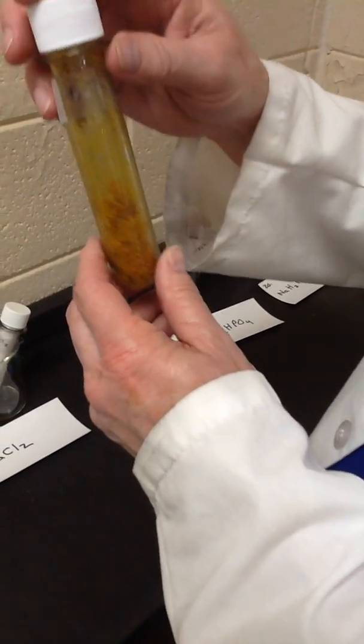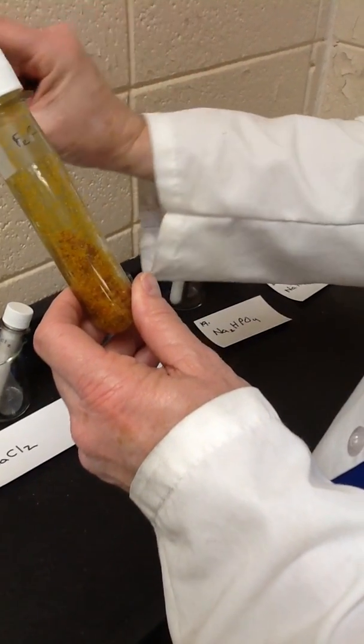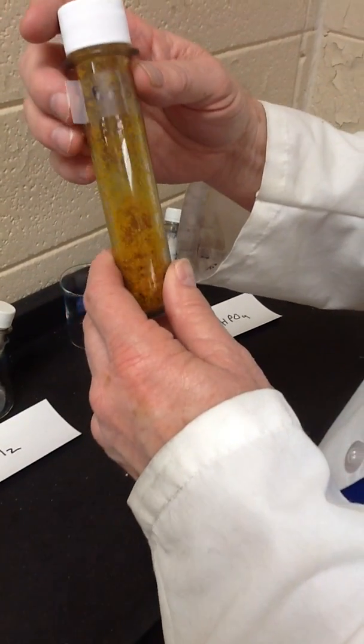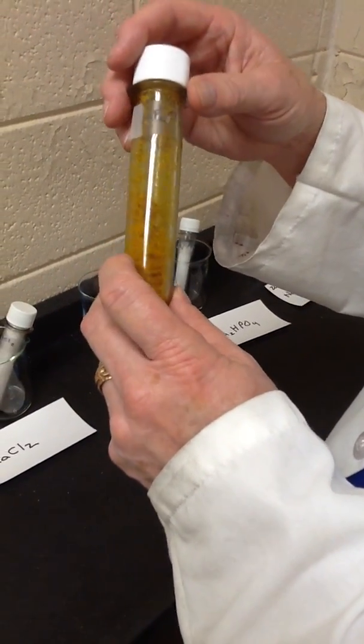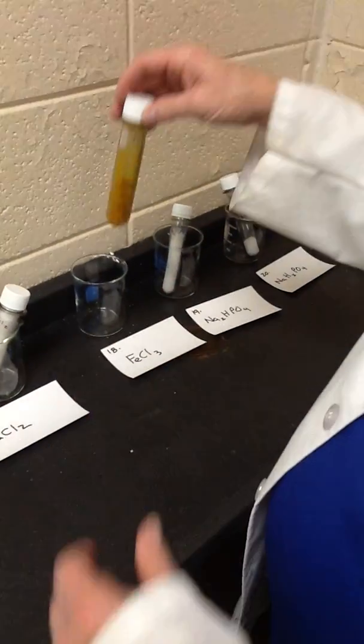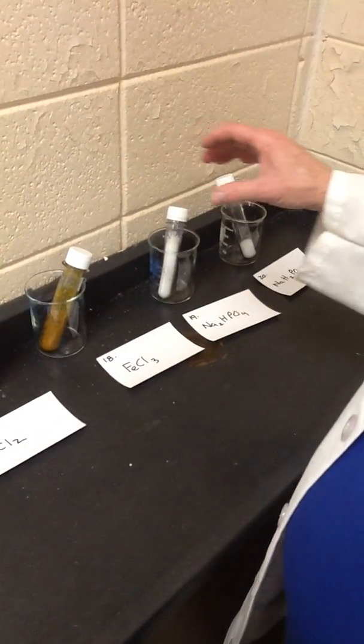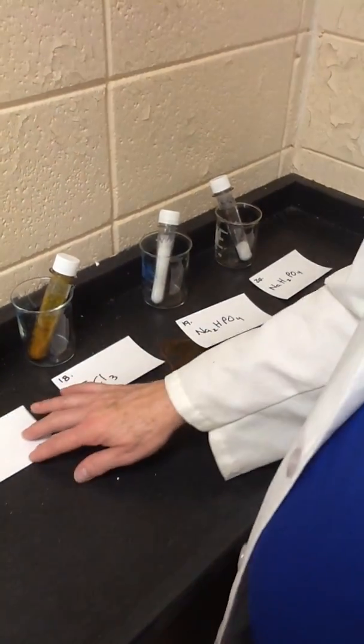But when you buy it, you look up its name, but the other thing you can also see on the label is its form. It's not really called crystalline. It says lumps, and you have to dig it and break it off the lumps to make a solution. Very difficult to weigh out, very difficult to accurately make a solution of defined concentration.